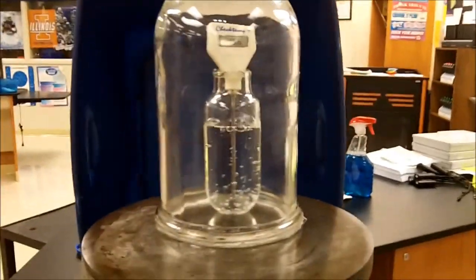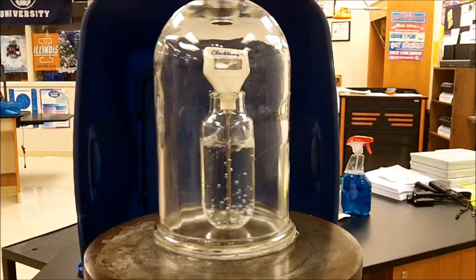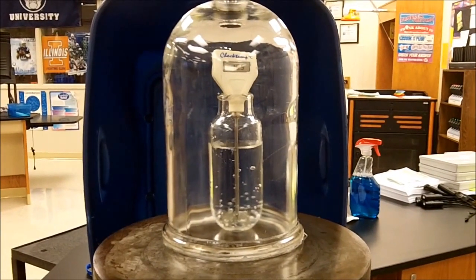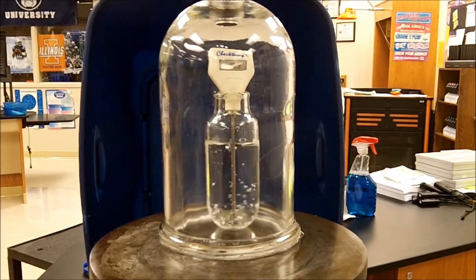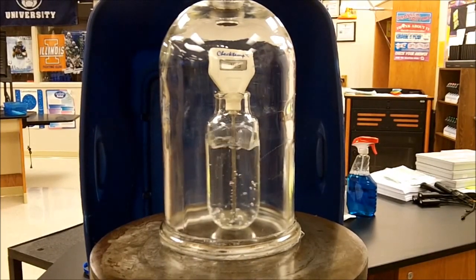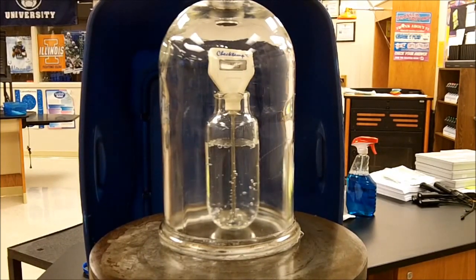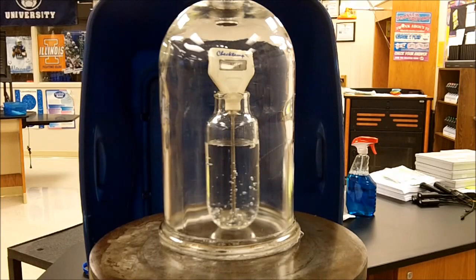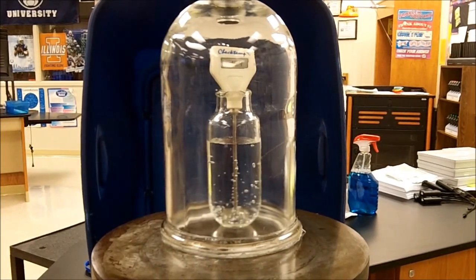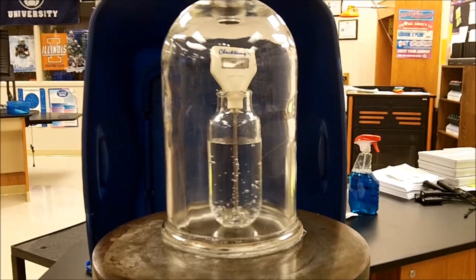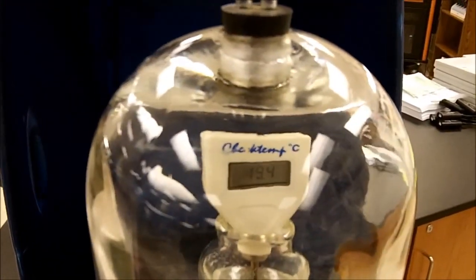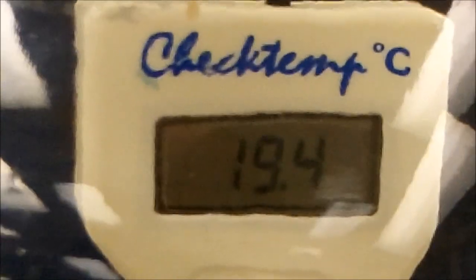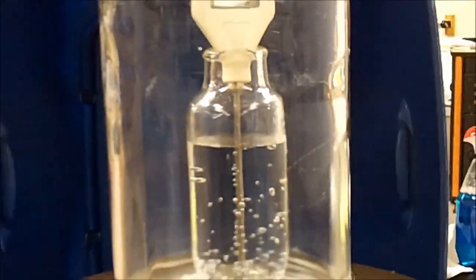Let me set up the camera. Okay, so let's go ahead and kill the pump. Okay, so as the atmospheric pressure got lower, the water in this case was able to boil. And again, this is just good old tap water. Now the final temperature, let me zoom in here. It says 19.4. So that dropped almost 1.4 degrees. Now I'm curious if any of you have any ideas as to why that temperature would have dropped. Let you think about that for a little bit here.